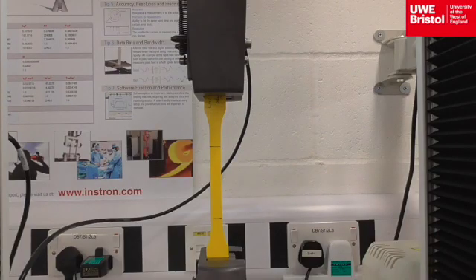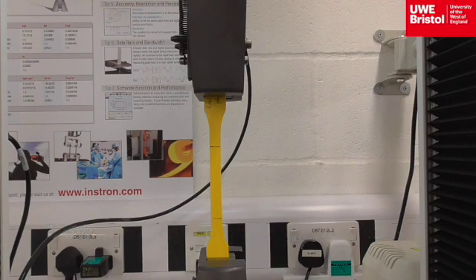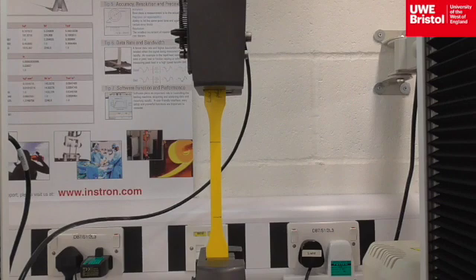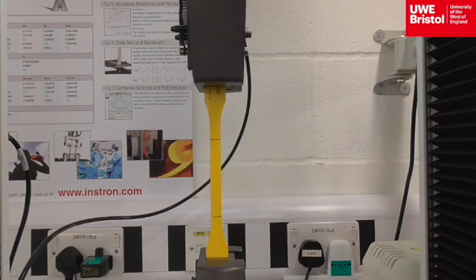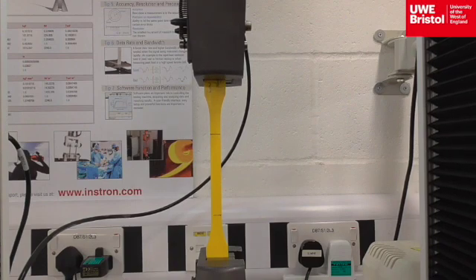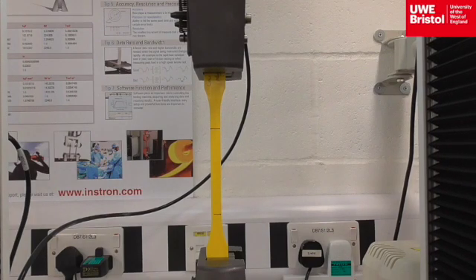This specimen is low-density polyethylene. The relevant data has been entered into the software and the rate of extension is 65 millimeters per minute. Testing now. Currently there are quite low forces involved in this test, around just under 400 newtons. Significant stress elongation can be observed.